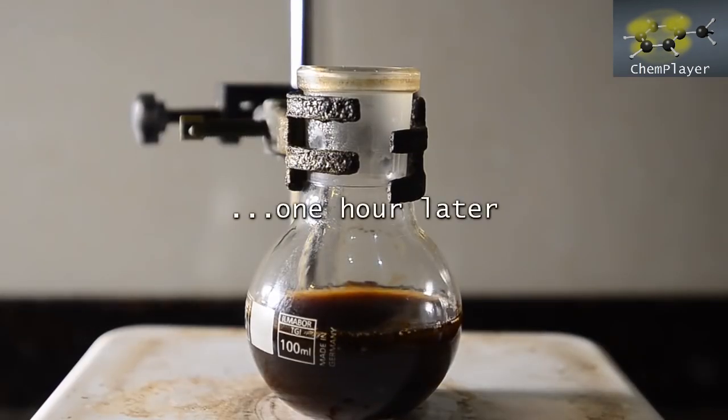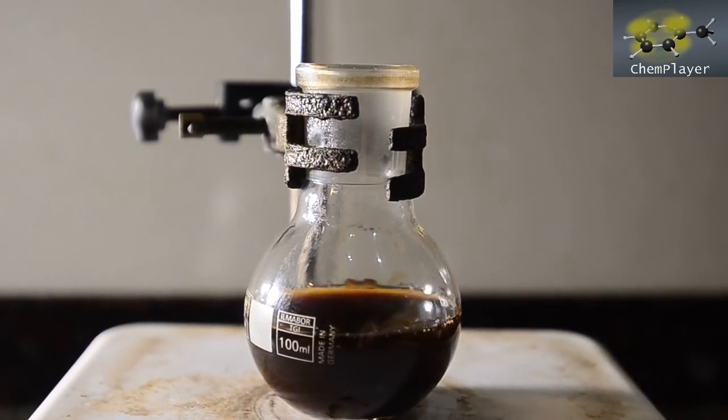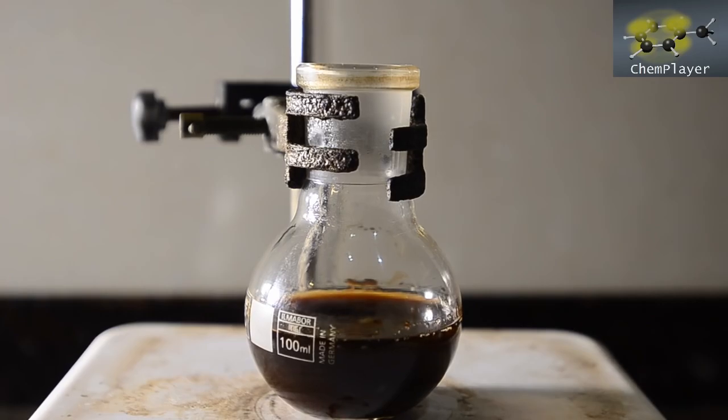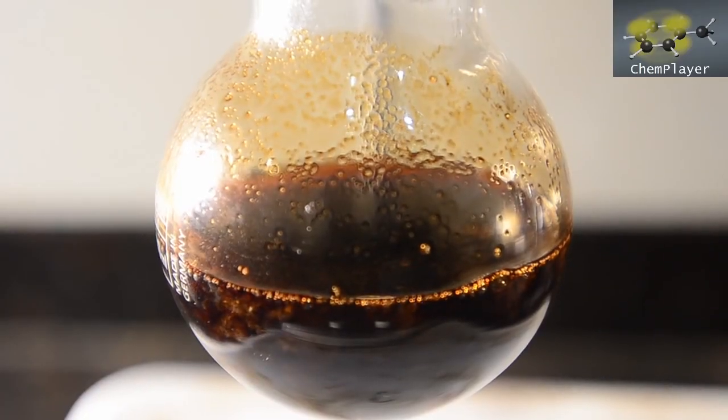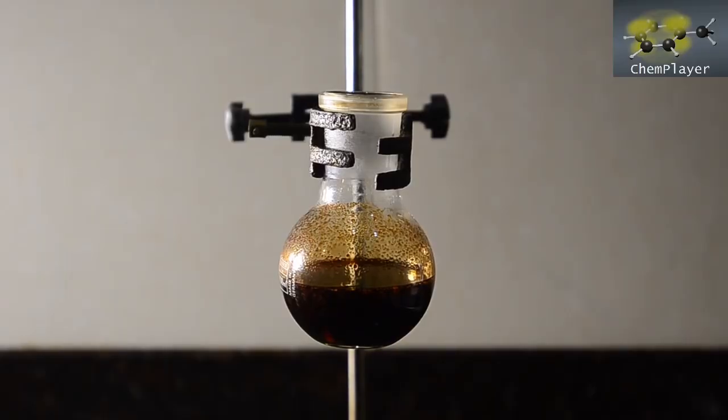Here we are an hour later. The mixture is quite dark, as you can see. We stop stirring and allow to cool. As it cools slightly, there's a brown flocculent precipitate forming in the mixture. So the first thing we're going to do while the mixture is still warm is filter it.